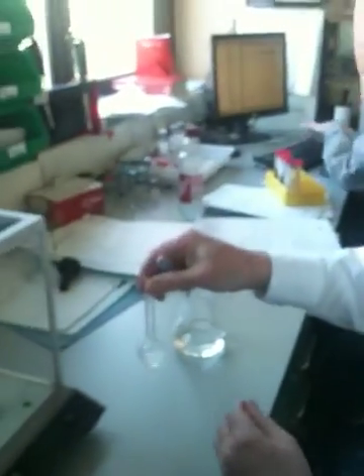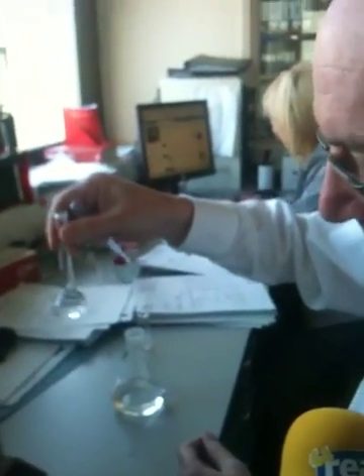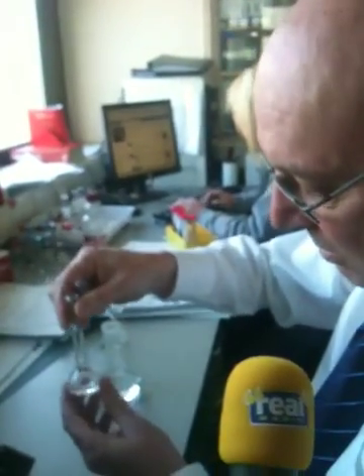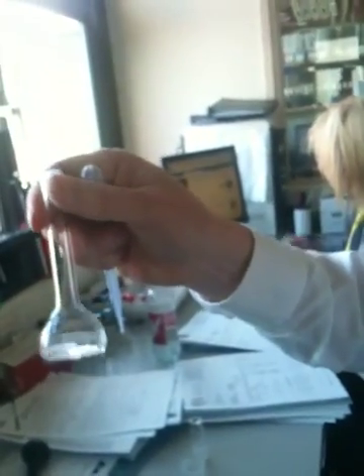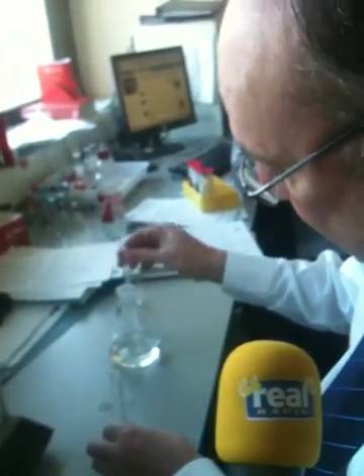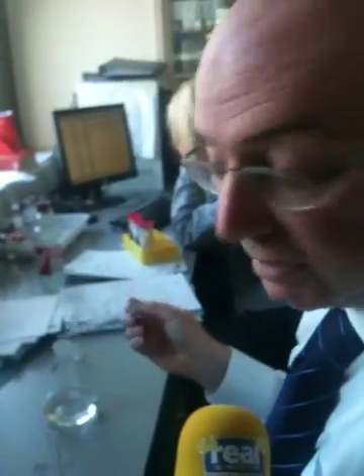So that will dissolve the actual mephedrone and leave you with what's been added to it? Yeah, well some of the substances, some of the adulterants might well dissolve, but it's a way of getting the active ingredients into solution and cleaning up the sample to some extent prior to analysis. As you can see, most of the sample is actually dissolving quite freely. So we'll then take this solution and analyse it by the mass spectrometer to find out what substances are actually present in the sample.